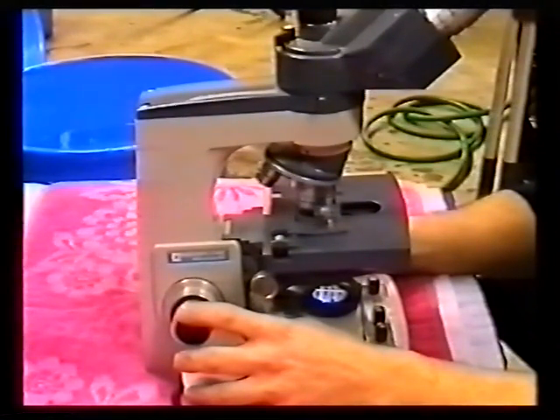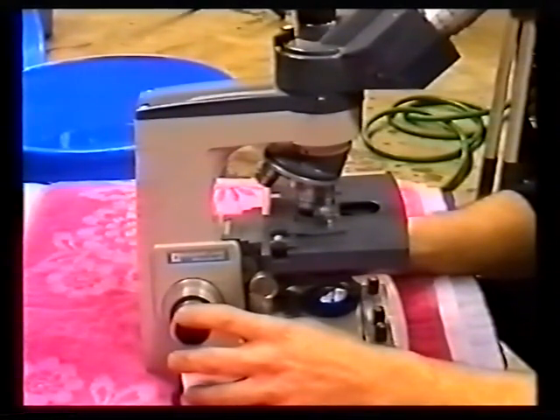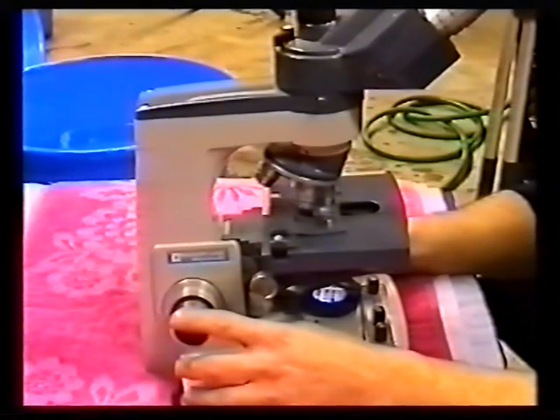Identification of juvenile stages is especially hard for the beginner, as they can be quite different to those you see portrayed in books. Good examples of this occur when viewing different life cycle stages of white spot and anchorworm, due to them passing through multiple changes.